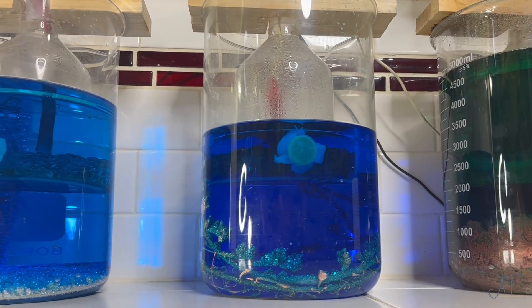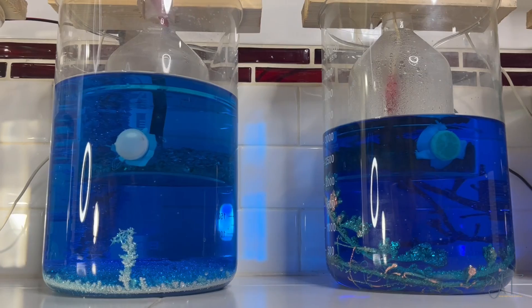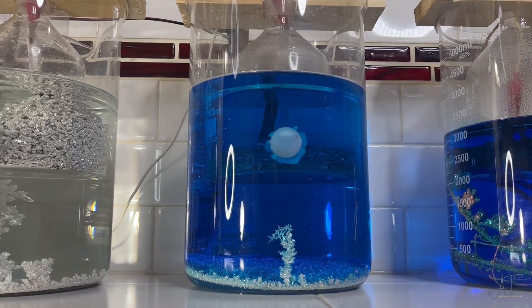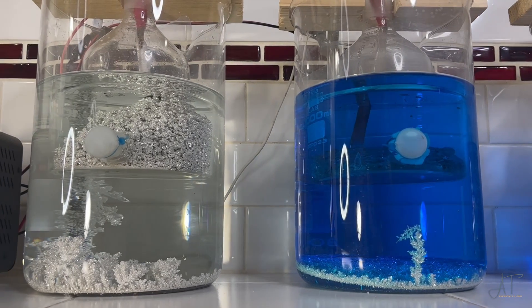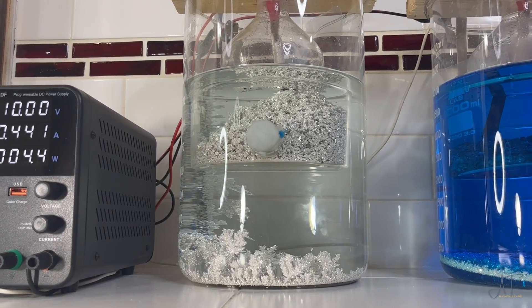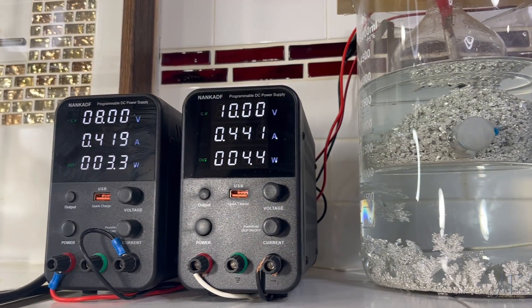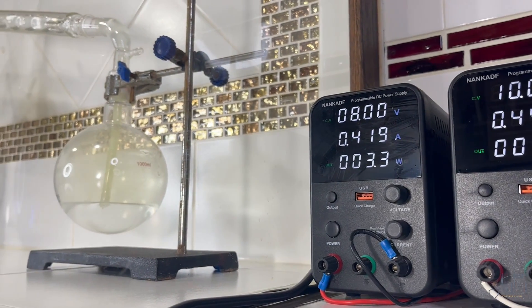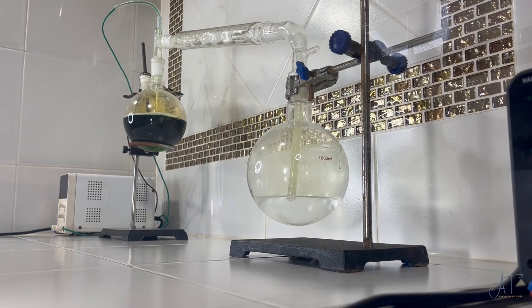We've learned how to recover our pure silver and copper from the electrolytic cells. Now let's learn how to remove our hydrochloric acid from the aqua regia solution that contains all the other base metals. What I found is you literally end up with no waste and you get a large portion of your acid back. I put together this system of refining because I don't believe there is such a thing as waste in chemistry. You truly do get out what you put in — it simply changes form.